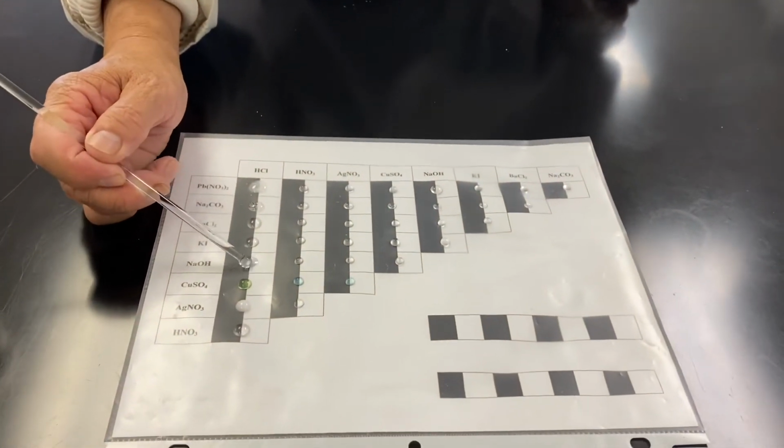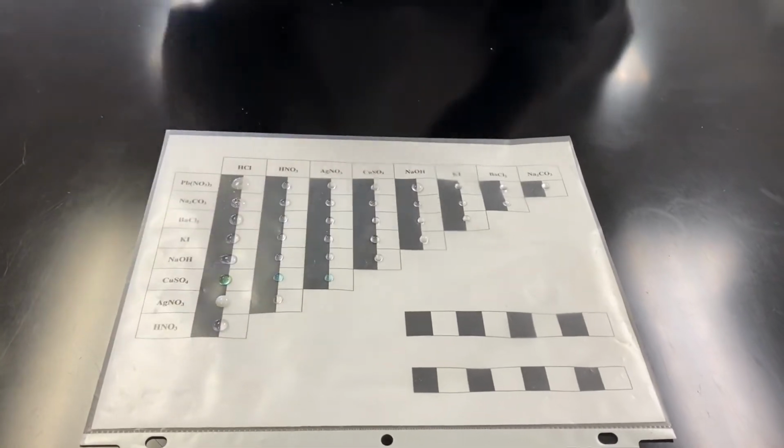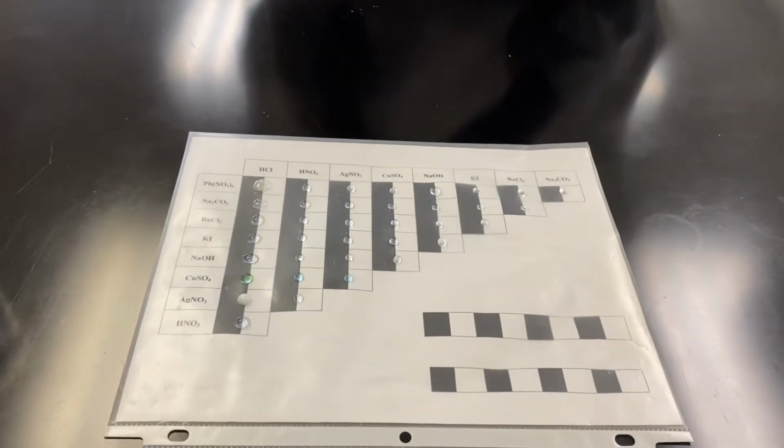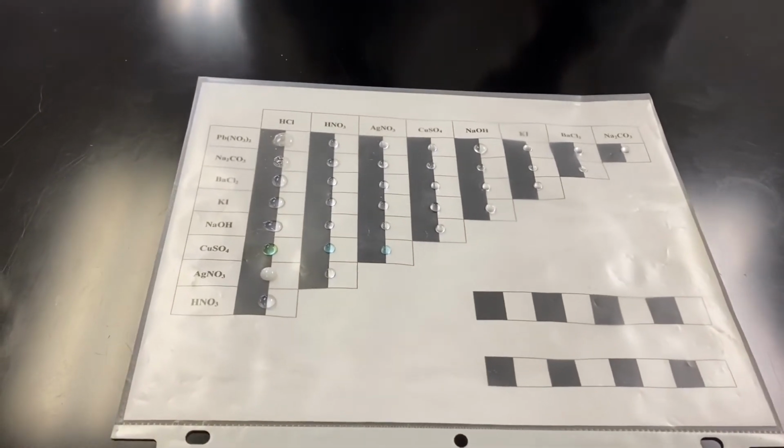All right, this is very interesting. If you're a chemistry student, you don't see something, but is there any reaction or isn't there? We think about it.